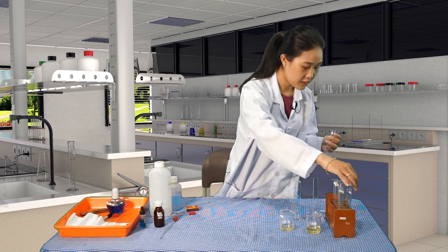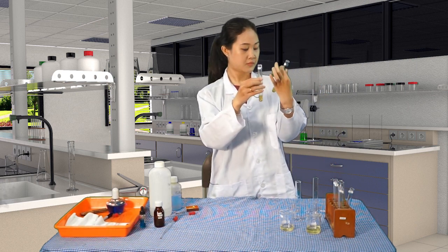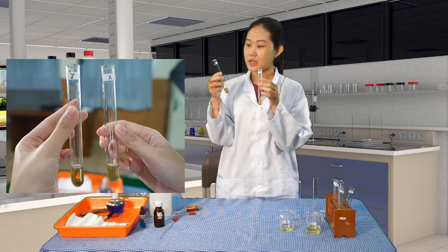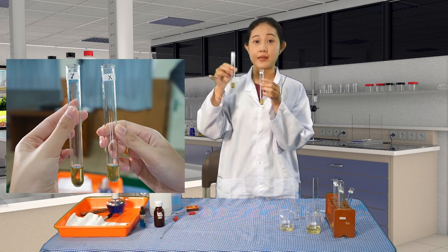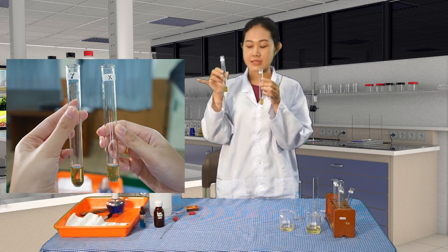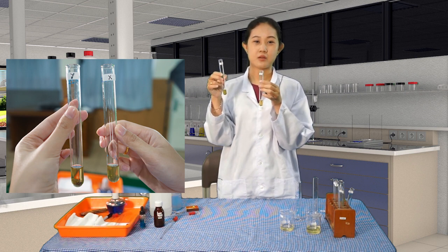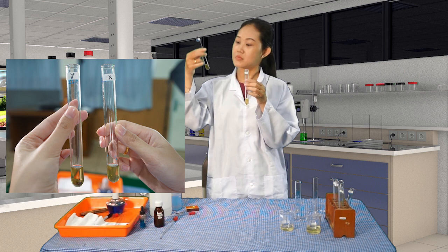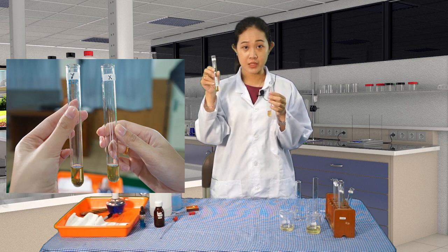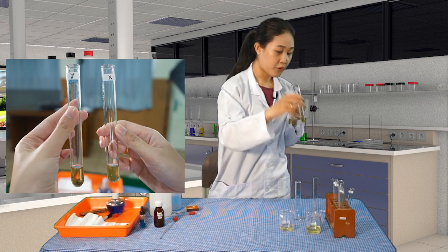This is the sample Y, okay, this is X and this is Y. Take a look carefully. So this is the sample X. You can compare the color with the chart here of the glucose Benedict test. If it is greenish, not so dark in color, this still indicates normal urine with the right amount of glucose, not that much, for the sample X.